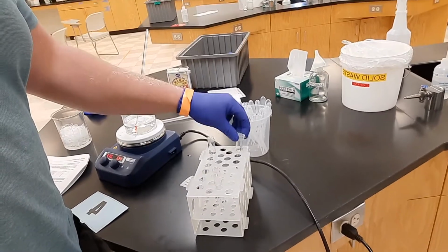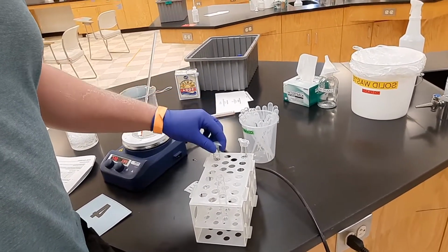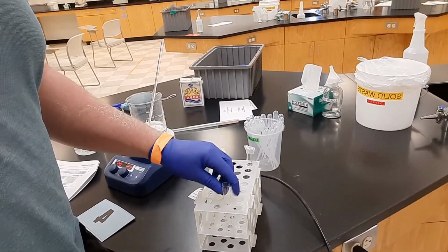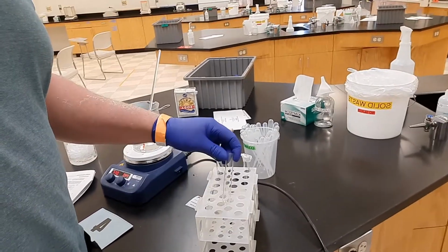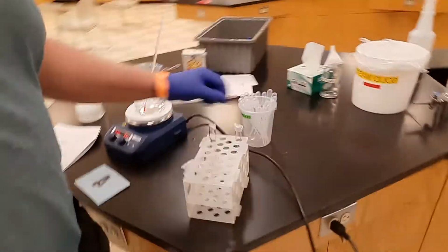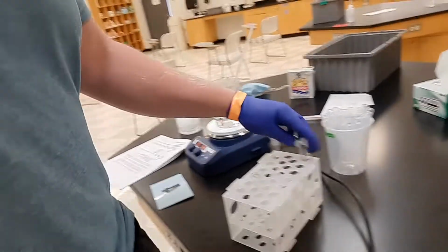I'm only going to do this example with 1 carboxylic acid and 1 alcohol. So I'll only have 1 product, and you're going to have 5 different products. So you need a nice organization system where you label the test tubes, have an ABC system set up here. My liquid carboxylic acid is acetic acid.